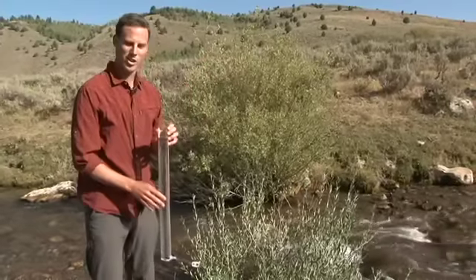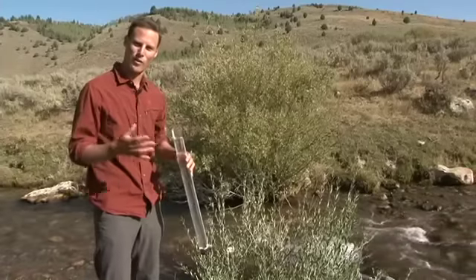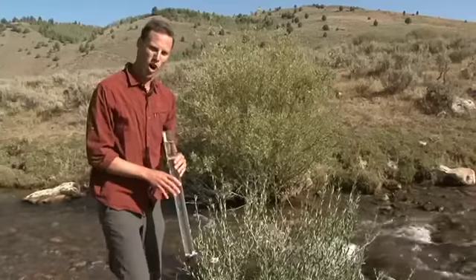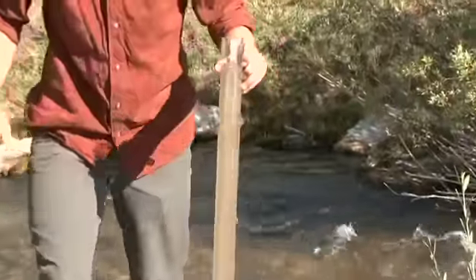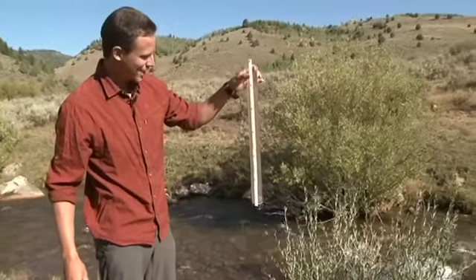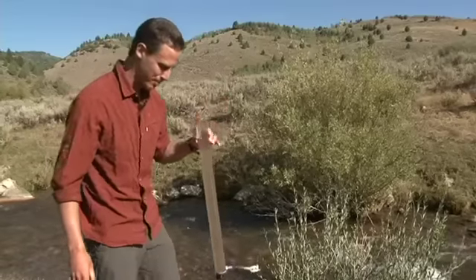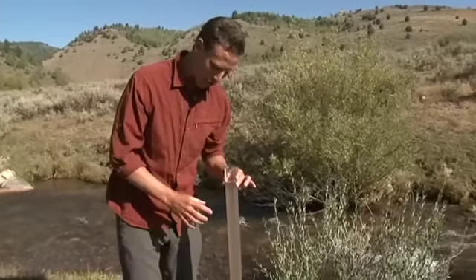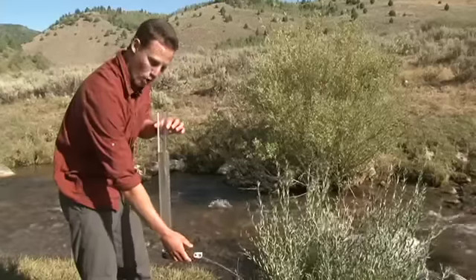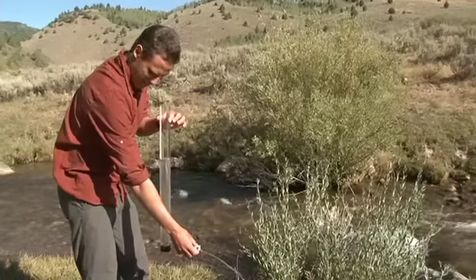Now let me demonstrate if you're on a different stream, such as the Colorado River or the Green River. They naturally have a higher sediment load, a higher turbidity. For demonstration purposes, I've artificially increased the turbidity by stirring up the water, so we have all this suspended sediment. Now when I look down through the tube, I can no longer see the white and black disc. Now we're just letting the water drain out so we can start to see the outline of the white and black disc.